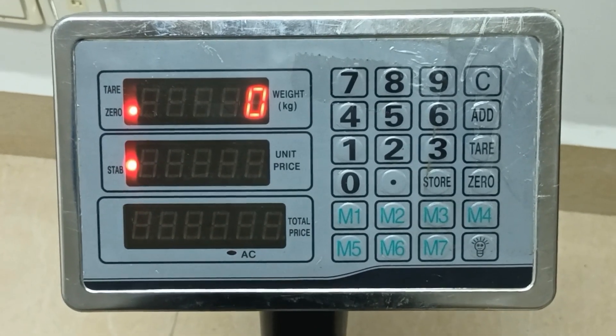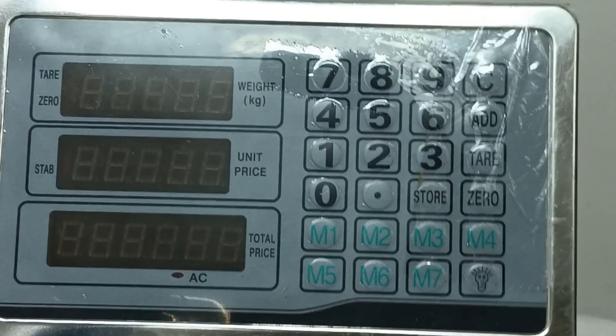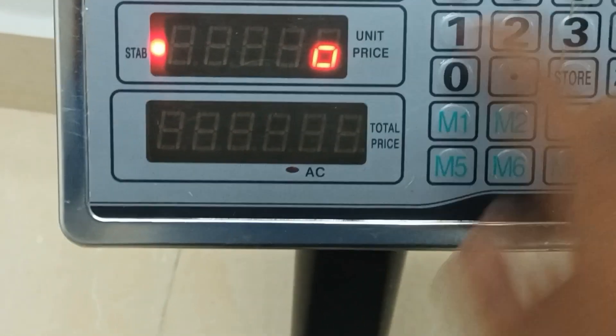I will choose to put the password: three, six, five, eight. And press enter.